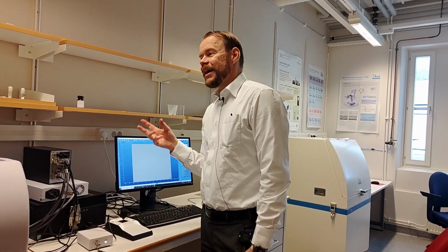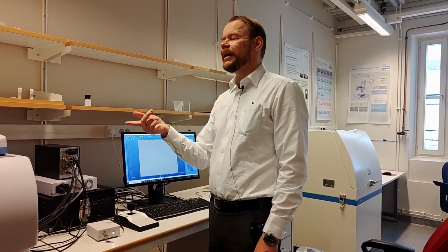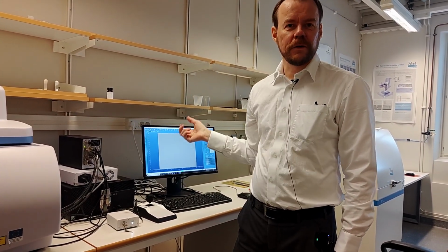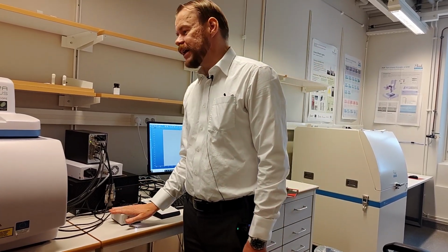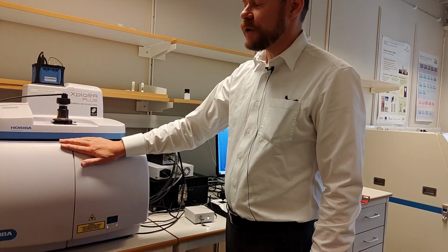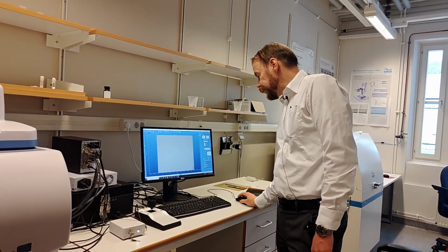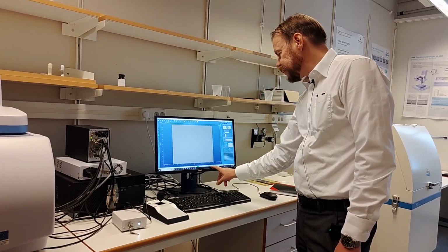I can't emphasize this enough, that you need to take it step by step, because if you don't have the laser, it is so easy to get confused on the way. So check your laser is on, check that the box is really closed, and then the next step before the calibration: here it says laser off and it says 100%.